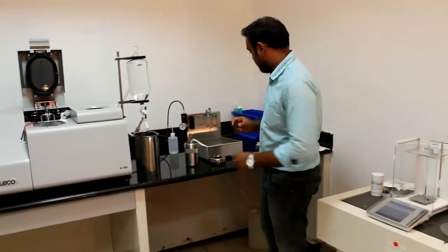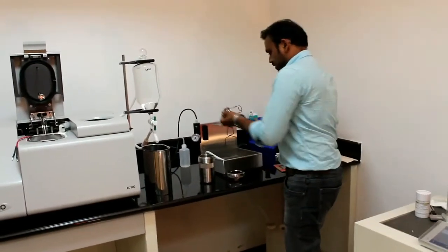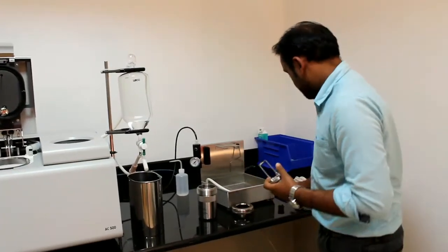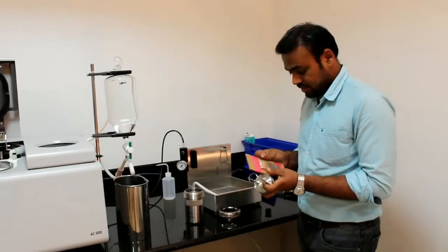We will place the sample in the crucible. First, we will put the red wire, this wire.